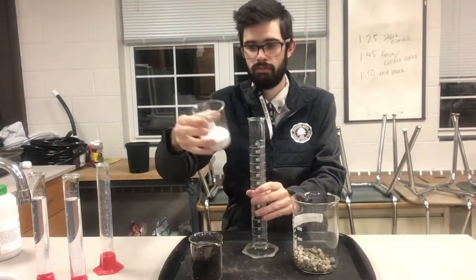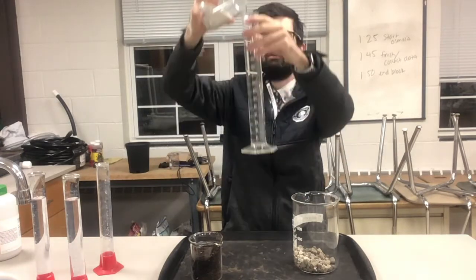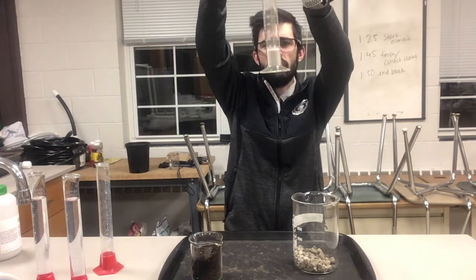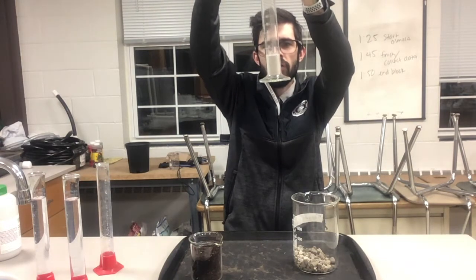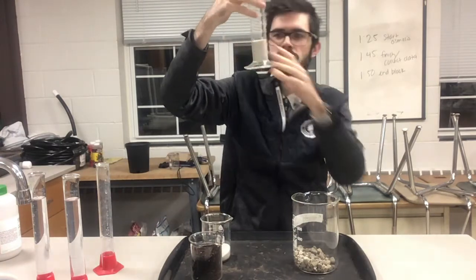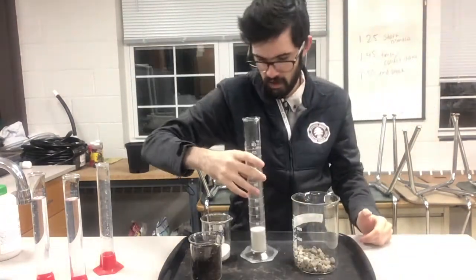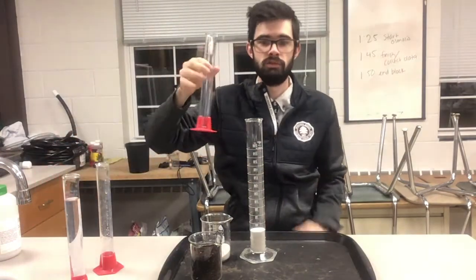Now I'm going to do sand — this is a really, really fine sand, and we're looking at 50 milliliters of sand. I'm going to do the same thing I did last time with the rocks: I'm going to dump in 100 milliliters of water.